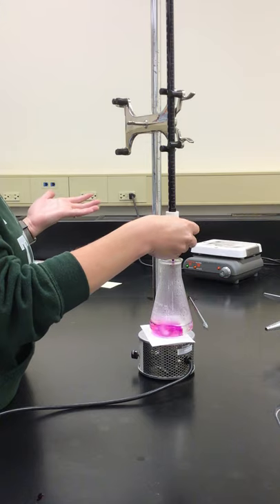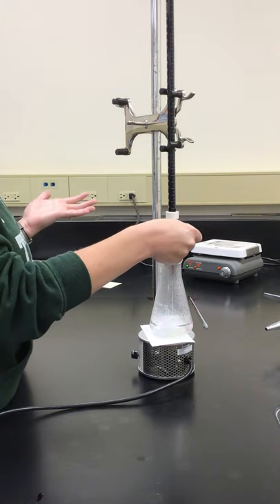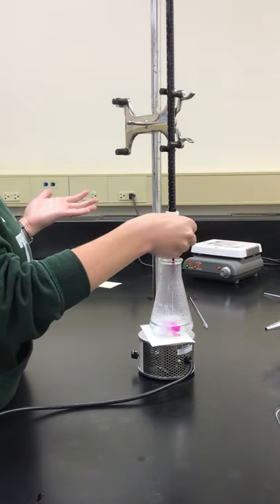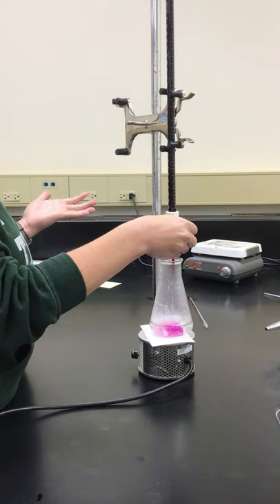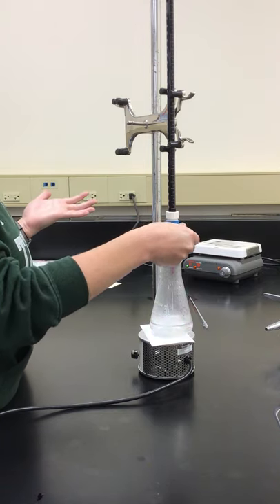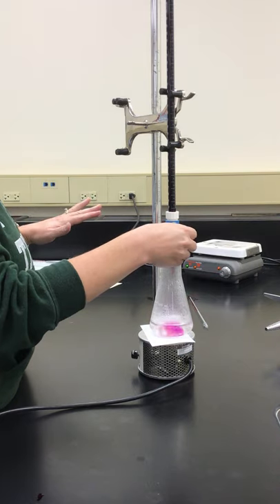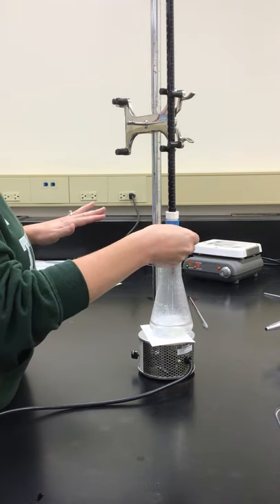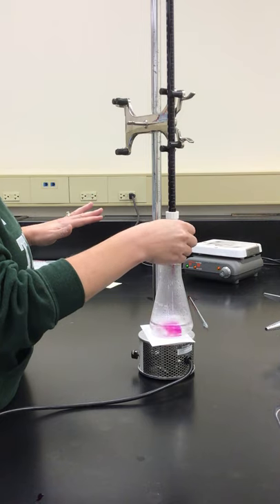So I'm going to keep adding a little bit at a time until we have that faint pink color persist. Then we know that the reaction is complete.